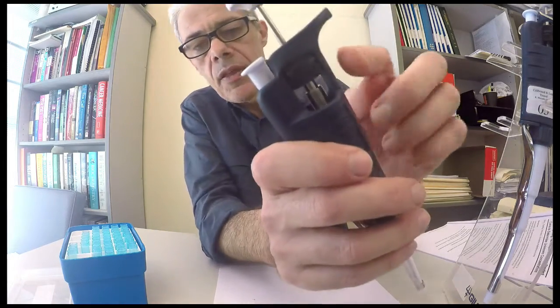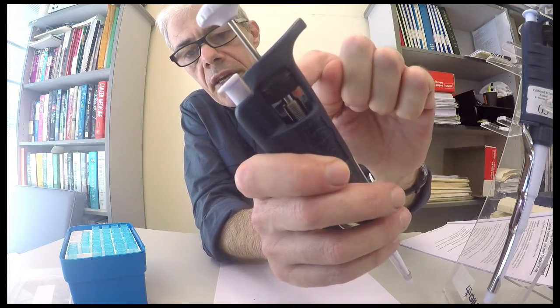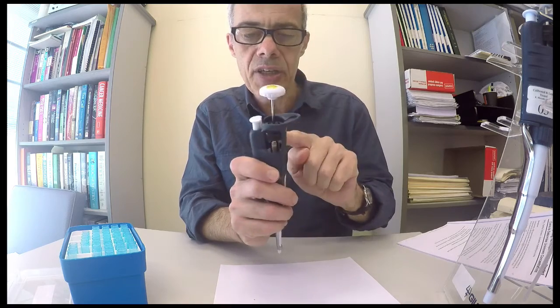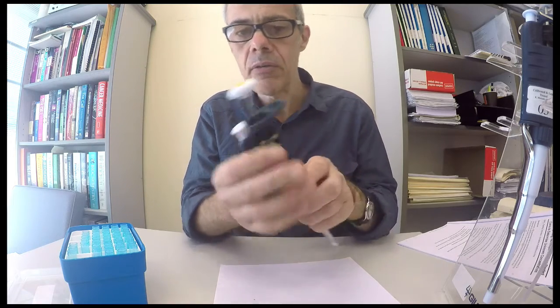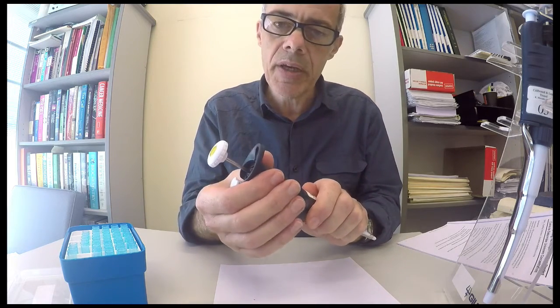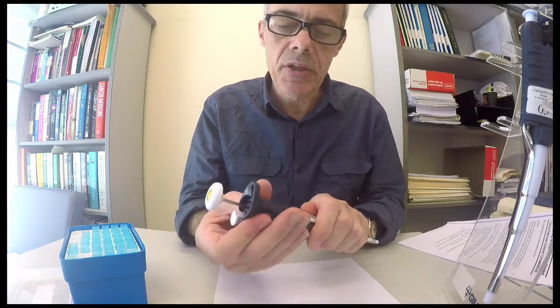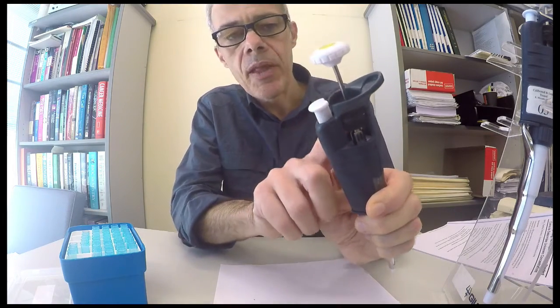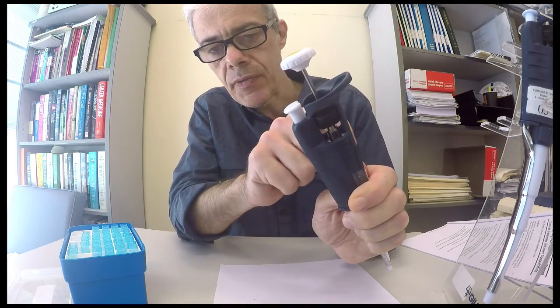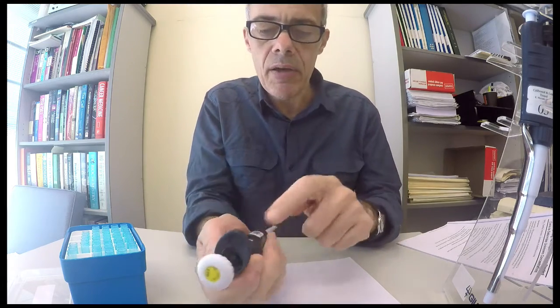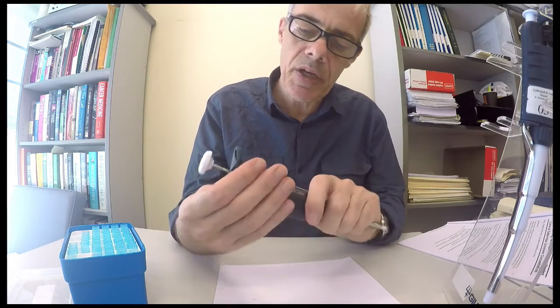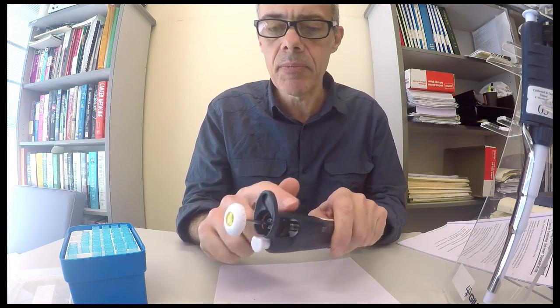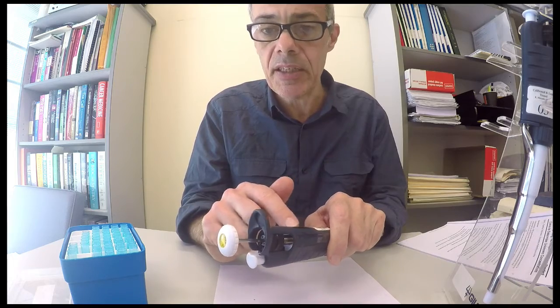You're going to damage the machine. So never wind this little wheel here too far up or too far down. And always be aware of where you are on the scale. So it's often a good idea to be looking at the scale whilst you're winding and be aware of what the maximum capacity of the pipette is.